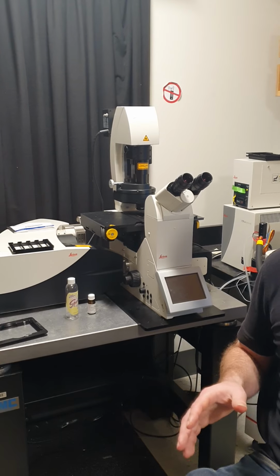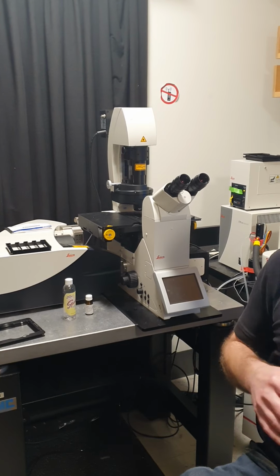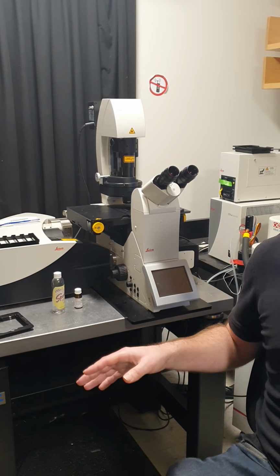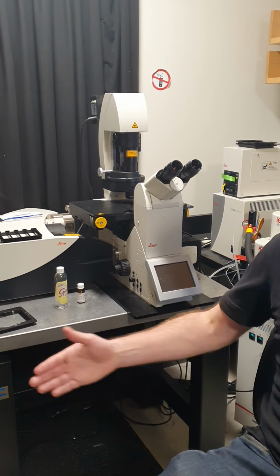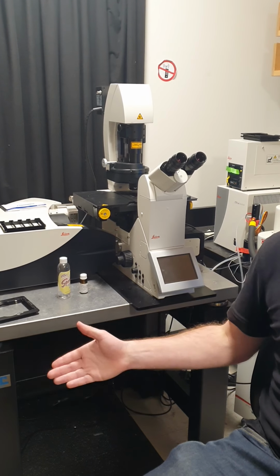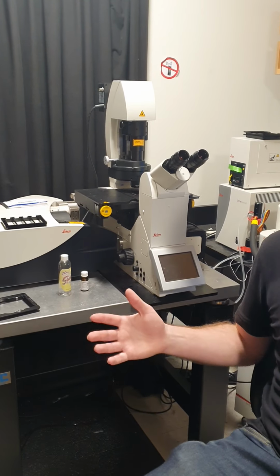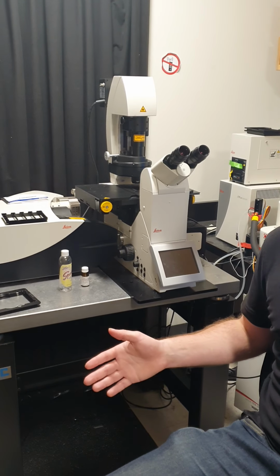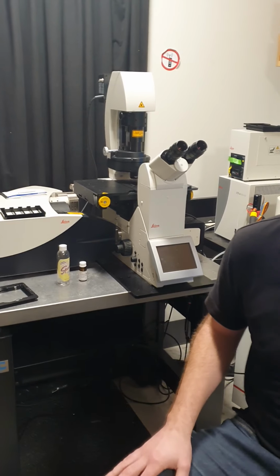There's also a lot of more advanced specialized things that it can do that, for the sake of time and not totally overloading you, we won't go all the way through today, but I'll try to show you at least what the capabilities are so that you know that they're options, and then if you want to use them in the future, then we can do more specialized training.